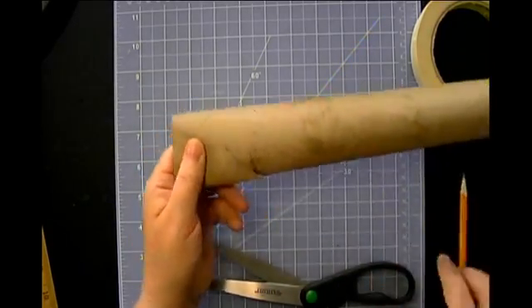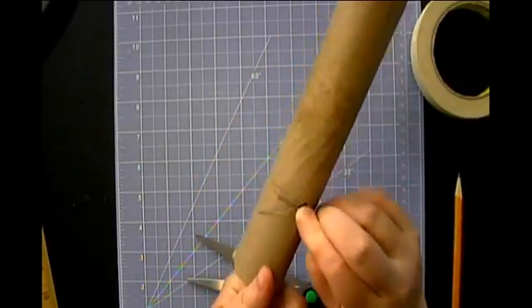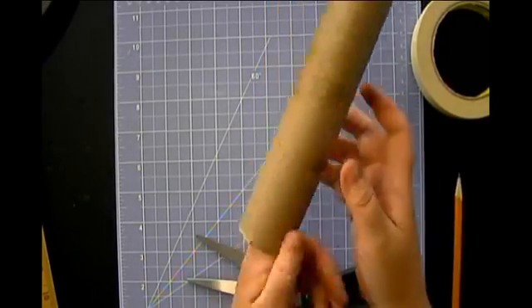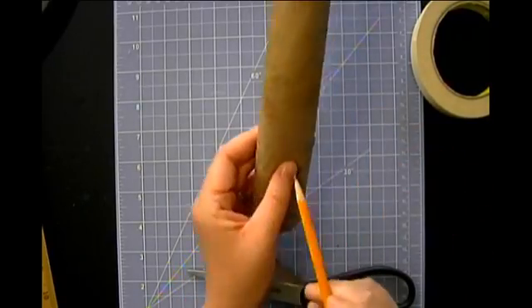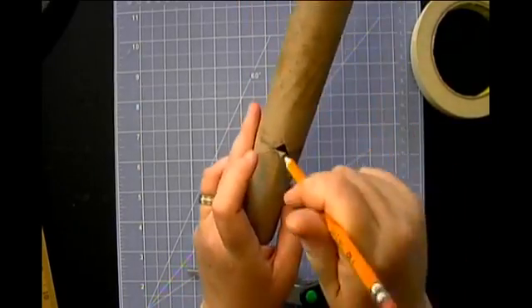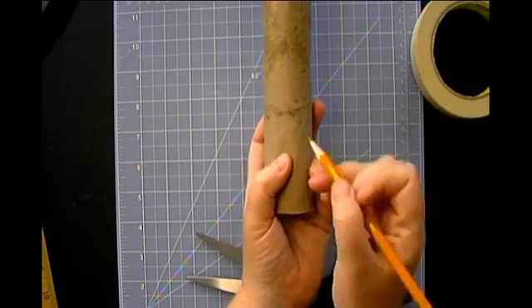Okay, great. I find that this can sometimes be a little bit of a challenge to getting my CD to sit right. So you could just fold down that little point a little bit. All right, now we're going to very carefully look to the other side. We've got our mark here. We want to make sure it's right across from where we put our viewing hole.